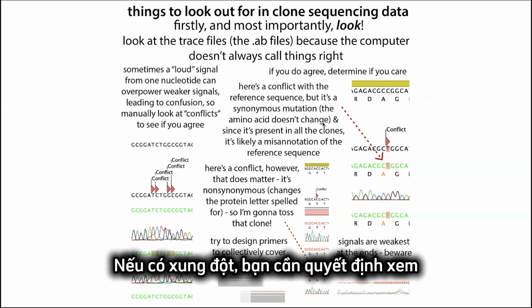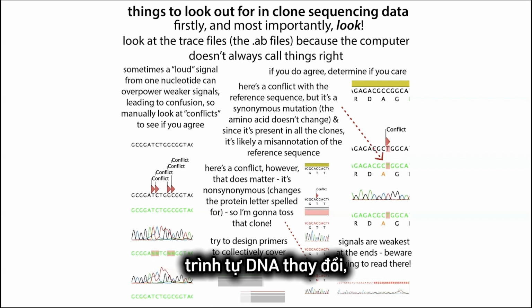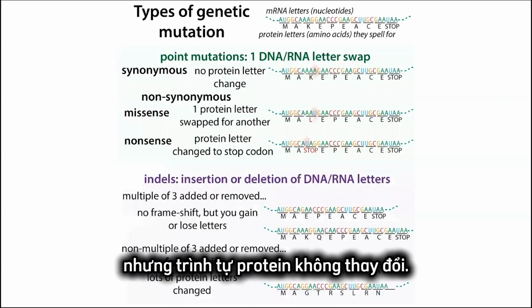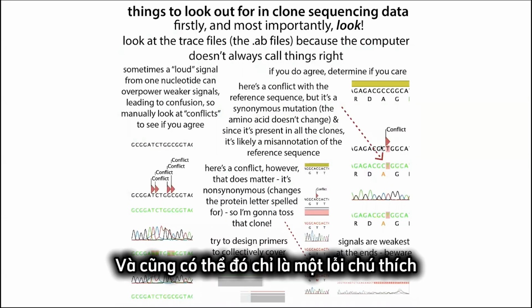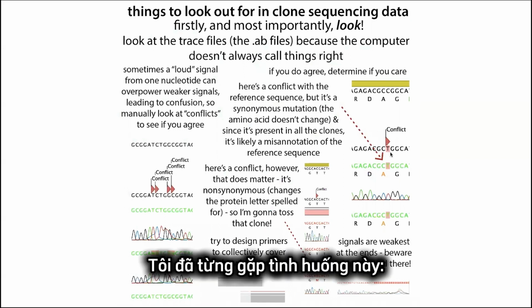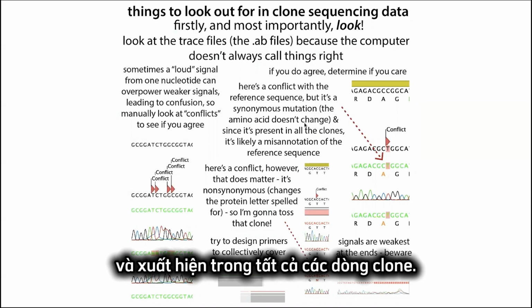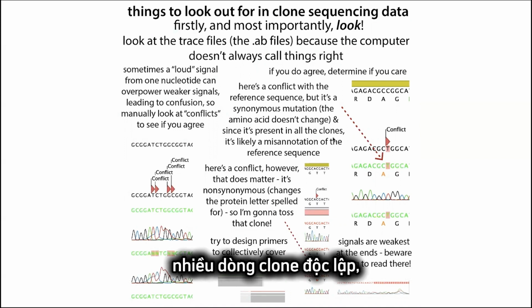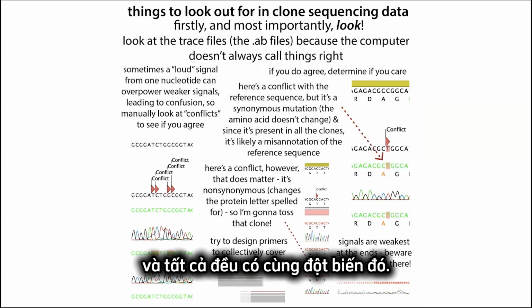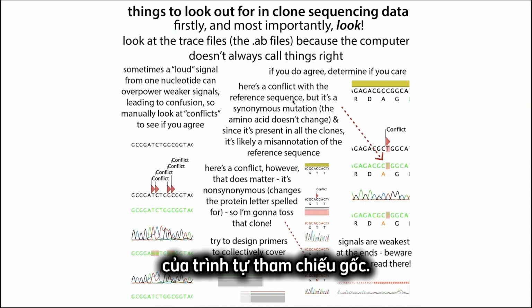Now if there is a conflict, you need to decide, does it really matter? Sometimes there's going to be a synonymous mutation where the DNA sequence changes, but the actual protein sequence doesn't change. And so maybe you don't care, and maybe it was actually a misannotation in your original reference. I've had this happen where there's a conflict with the reference sequence, but it's a synonymous mutation and it's present in all of the clones. If I tested multiple clones and they all had the same mutation in there, which didn't change anything, it was probably just a misannotation of that original reference.